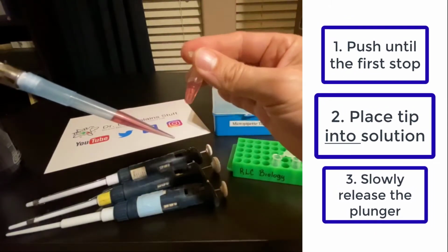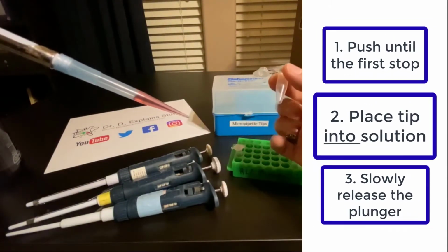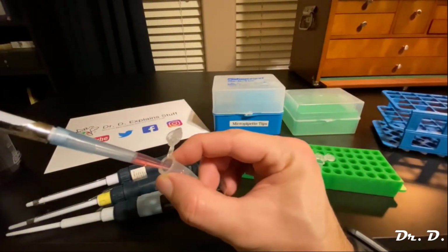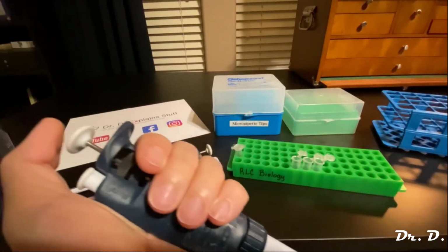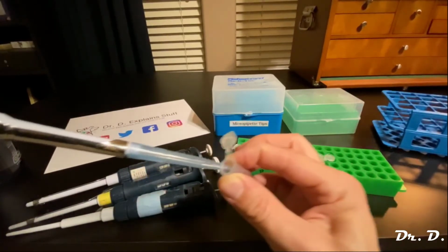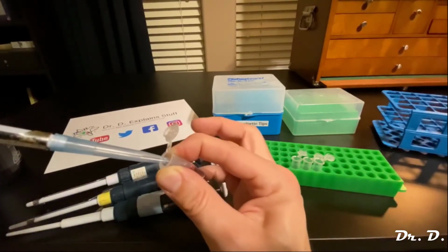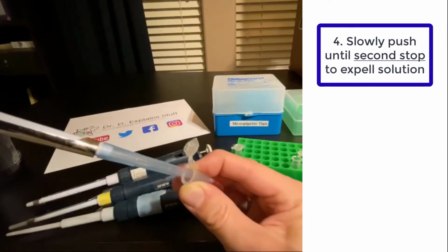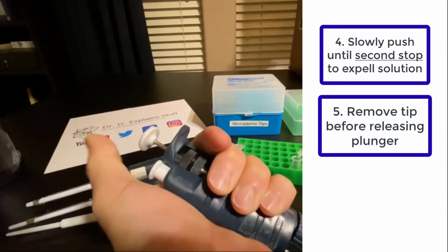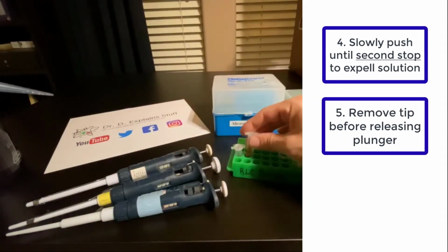See, 500 microliters are left in my tube, and 500 microliters are now in my pipette. And here's my new tube. I place the tip in the tube. You can even touch the tip to the side of the tube. And then I push my thumb very slowly, and look how the solution comes out. Now I've reached the first stop. So now, without removing it, I push till the second stop just to make sure to expel everything. Then I get the tip out of there, and then I release my thumb. Does that make sense? And then I close this, and now I have 500 microliters in there.